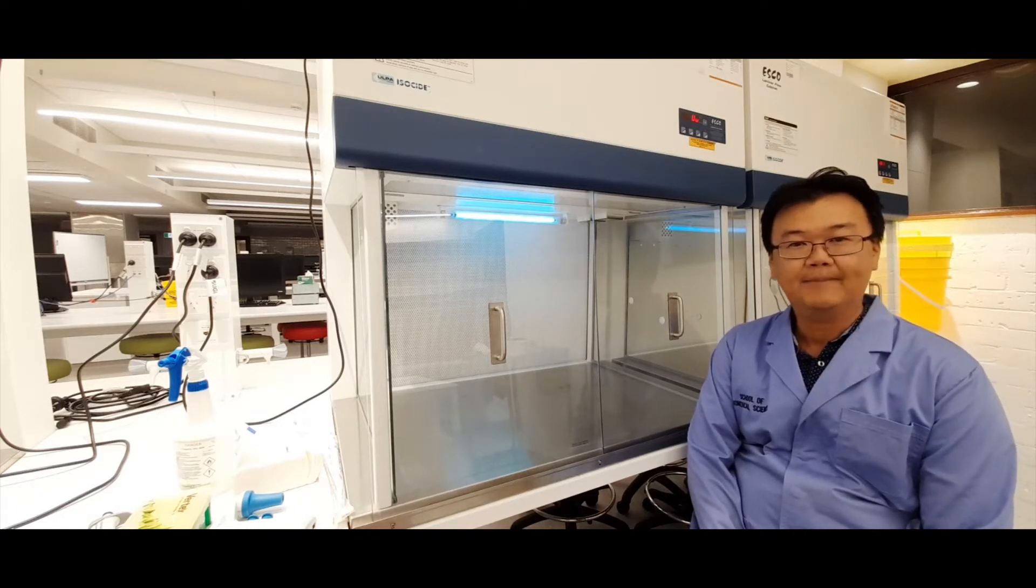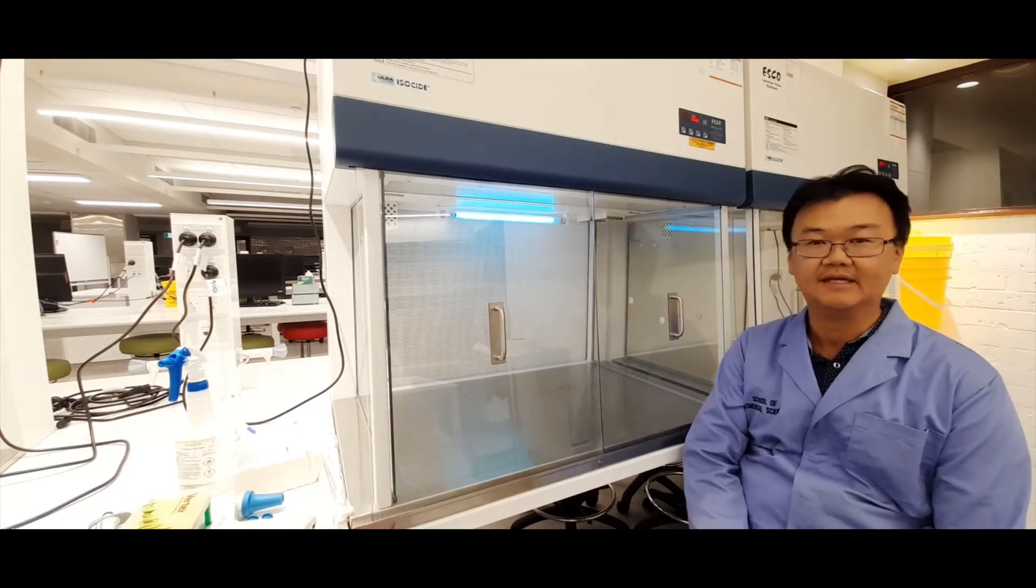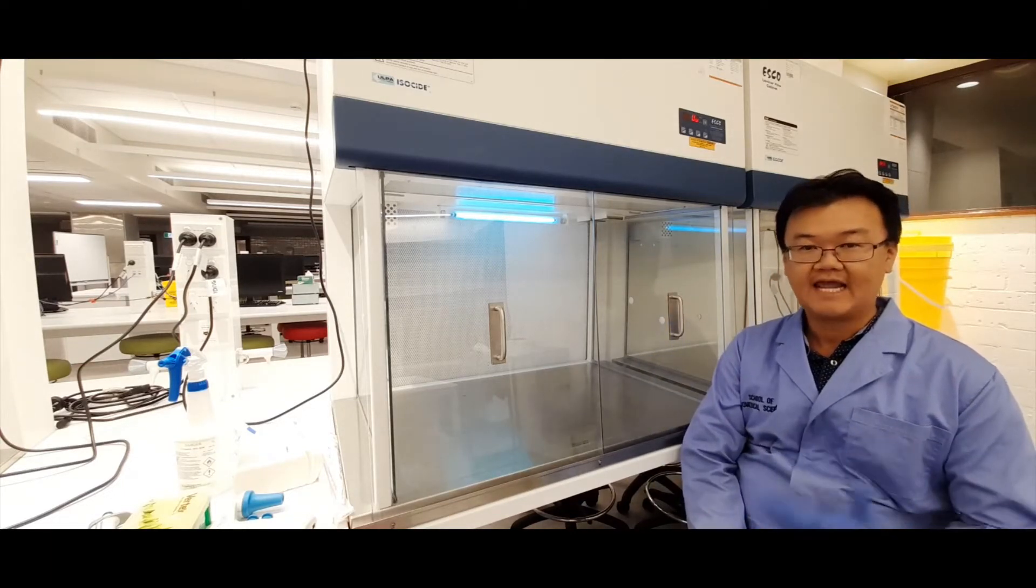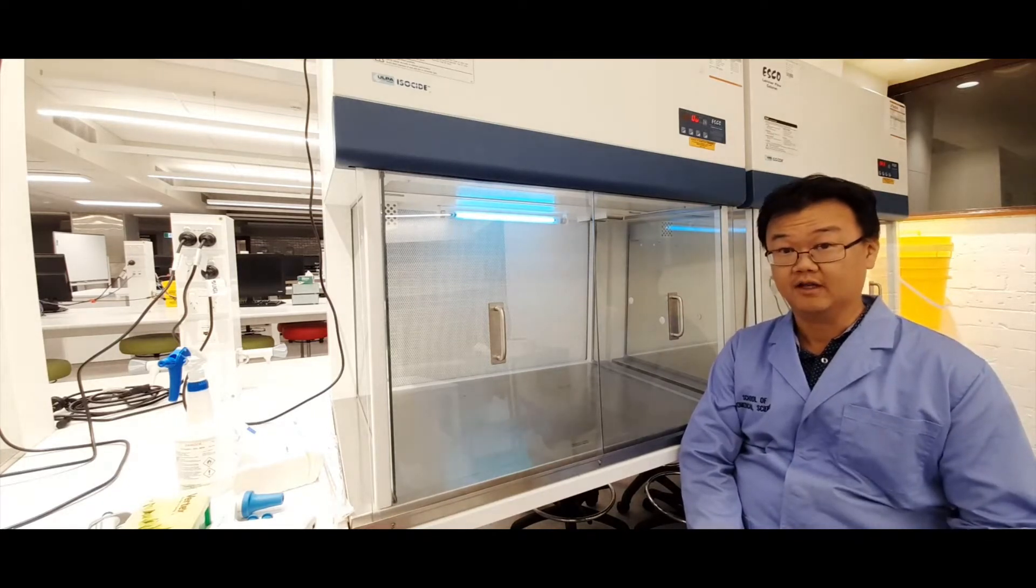Okay, hello class. In this video, I'm going to show you how to use one of these biosafety cabinets to maintain a sterile work environment while you do your cell culture work for the laboratory.